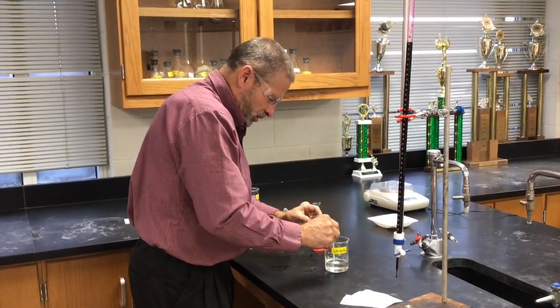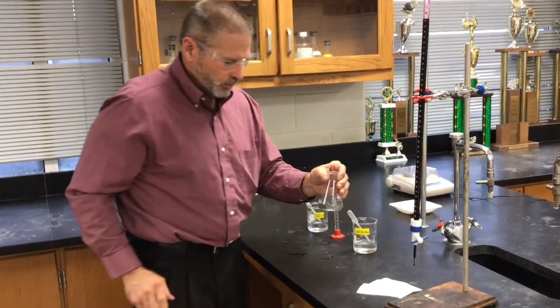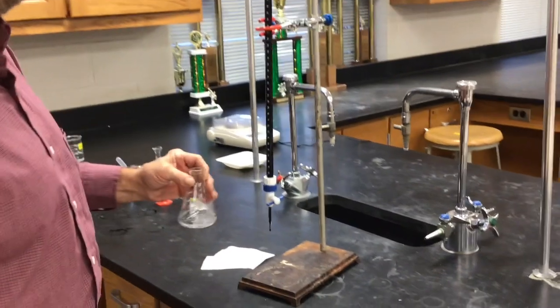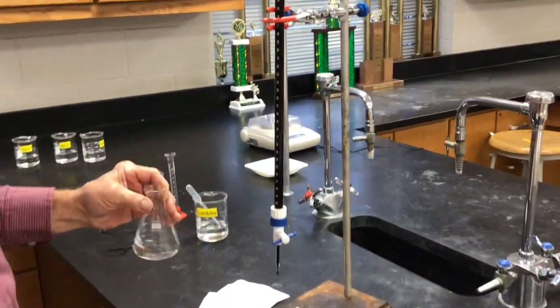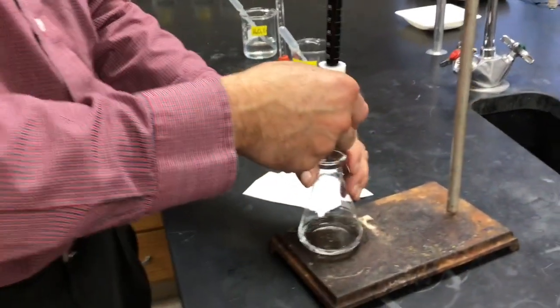Okay, a couple big squirts of acid. Ready to go again. Okay. So we should be able to take it down to about 22 or so pretty quickly.